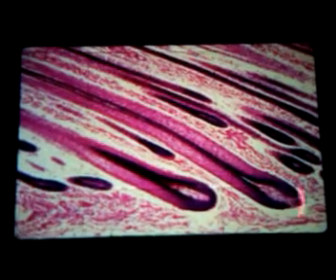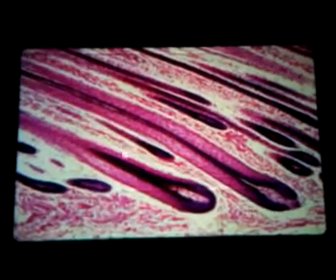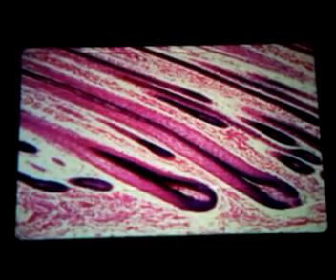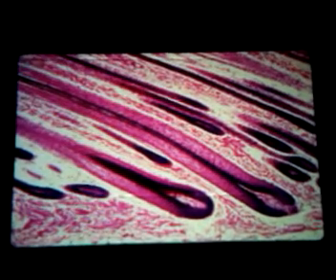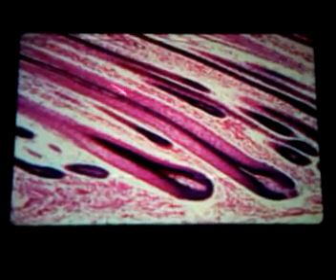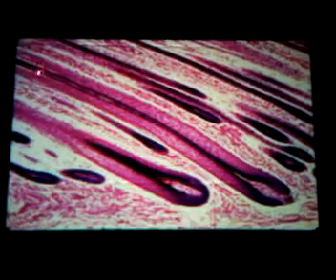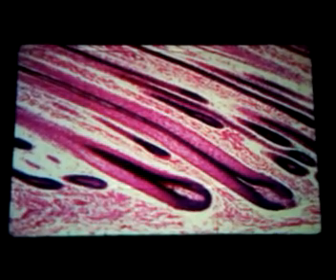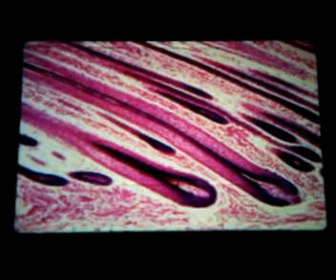Hair follicles, hair roots, hair bulbs. You can see the pigment down here, and you can tell that the hair shaft is ultimately going to be black, just because of the amount of melanin there. You have the dense irregular connective tissue down here, dense irregular all over the place, but you just have these follicles. Now, note in this, we have this little ladder appearance. In section, the hair shaft has these little rungs of the ladder. In your sections, most of them will be yellow-green, and most of them you'll see in cross-section.